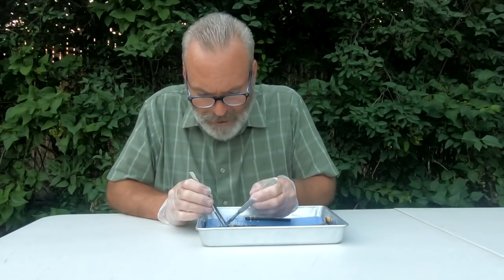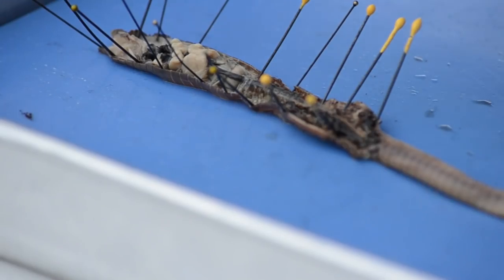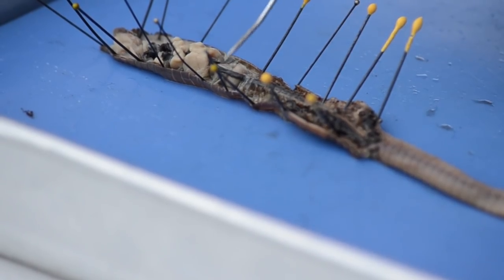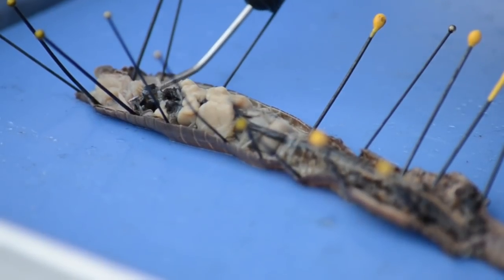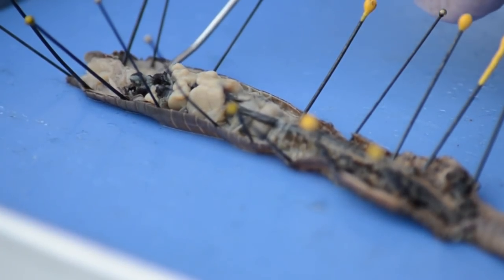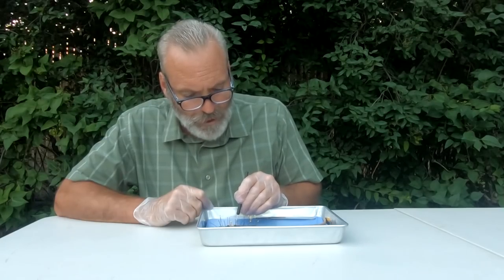Let's start from the anterior and move to the posterior — these are the basic terms in anatomy your teacher will ask you to know. The first is the pharynx, right here — a muscle it uses to bring in the food, like a muscular pump, bringing food in through the mouth. Between this pharynx and the crop is a tube called the esophagus, right here. So the mouth is here with the prostomium, food comes into the pharynx, into the esophagus, and then moves down that tube and goes into the crop. The crop is very, very soft to the touch.